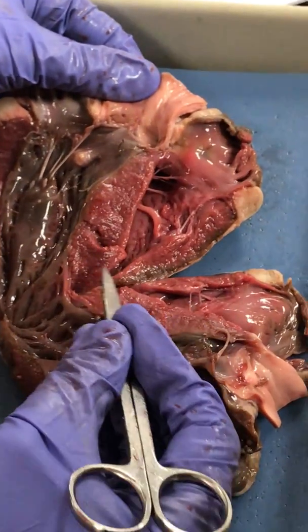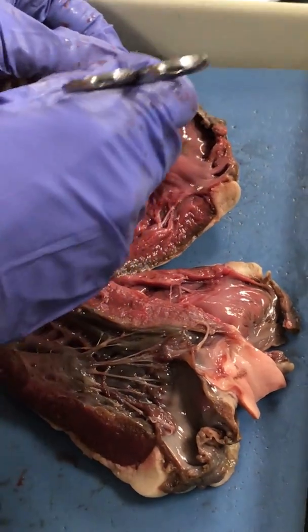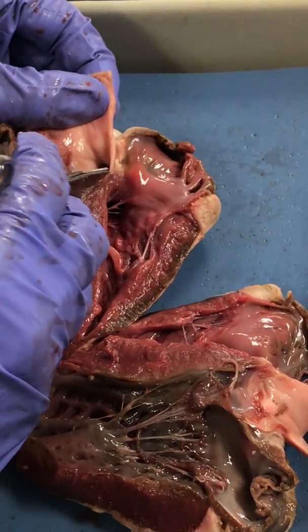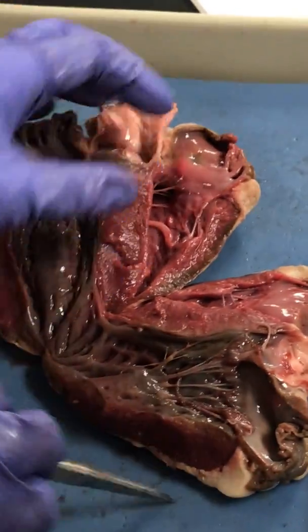And we have two reasons to confirm that they are aortic semilunar valves. One is the vessel leaving the left ventricle. And two, you can see an opening for a coronary artery right there and right there. Okay. And the pulmonary trunk doesn't have coronary arteries leaving it, okay? So that's the left side of the heart.